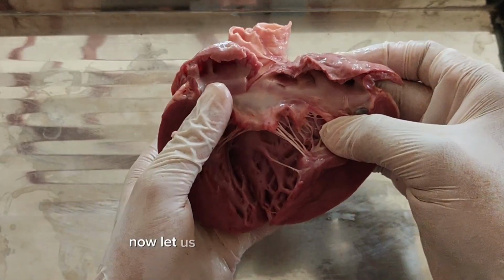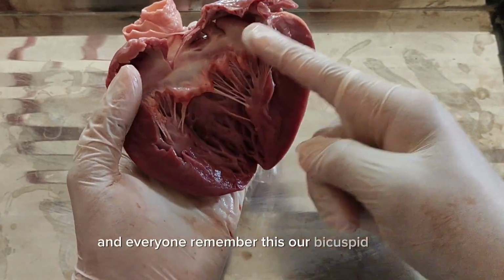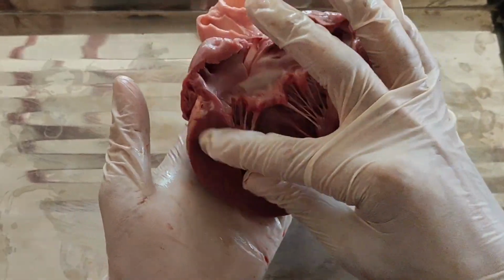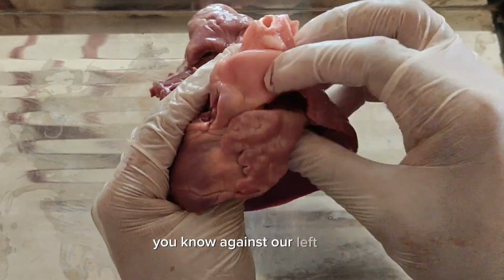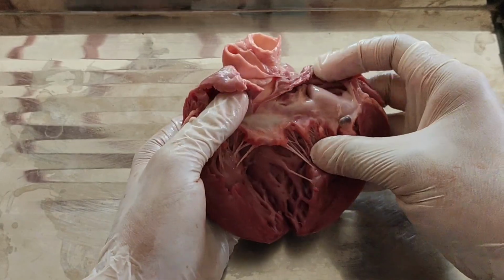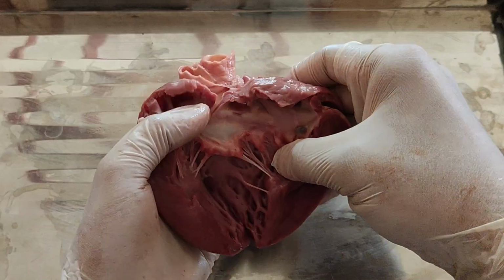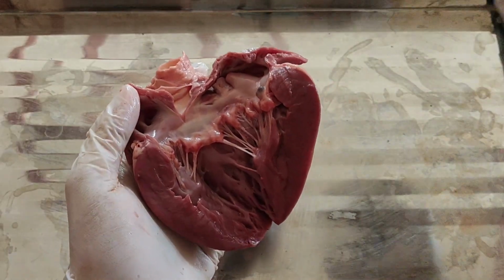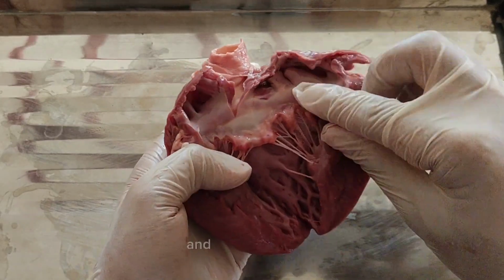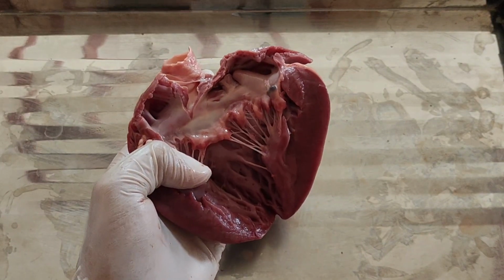Now let us cut open through it again. And everyone, remember, this is our bicuspid valve. This is the lower part of the ventricle. It's very thick, you know. Again, it's our left atrium. Now let us proceed with cutting on this part towards the aorta. We're going to cut it again. You can use anything that you want to cut it. Let us cut across the left ventricle through the aorta.